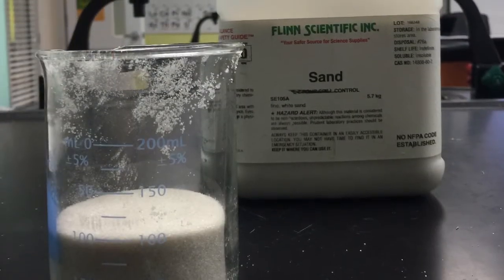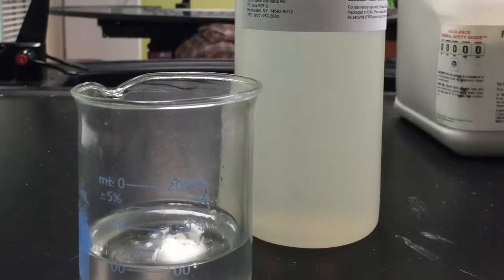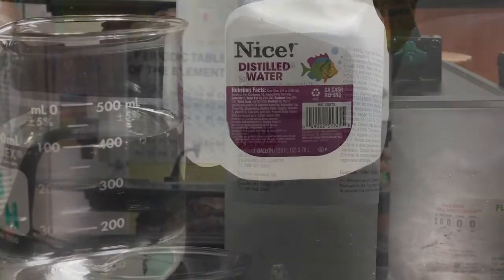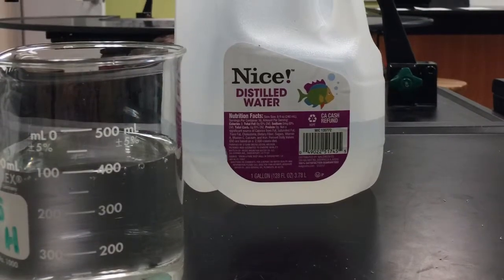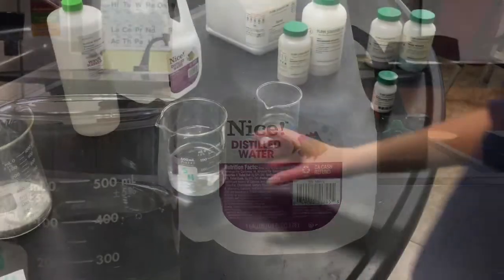Step 2. Fill a small beaker with 100 milliliters of sand. Step 3. Fill another small beaker with 100 milliliters of sodium silicate. Step 4. Fill a medium-sized beaker with 400 milliliters of distilled water.